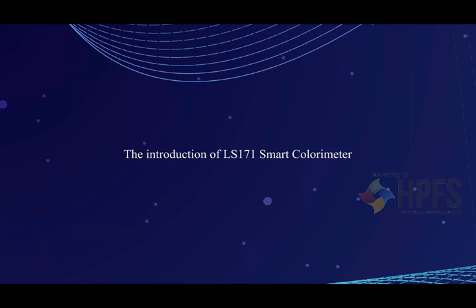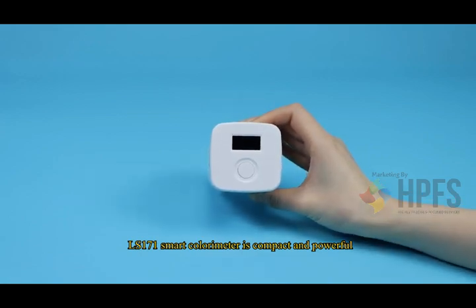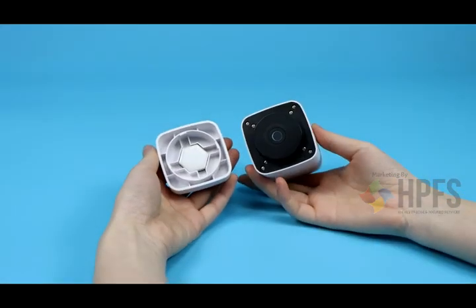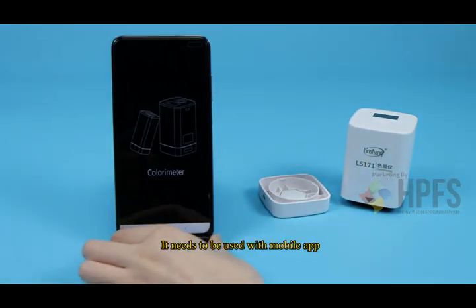The introduction of LS171 Smart Colorimeter. LS171 Smart Colorimeter is compact and powerful. It needs to be used with a mobile app.